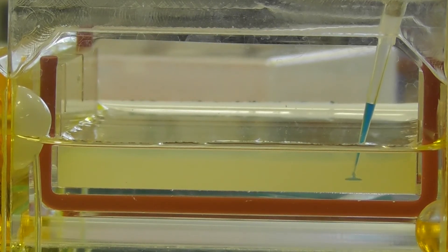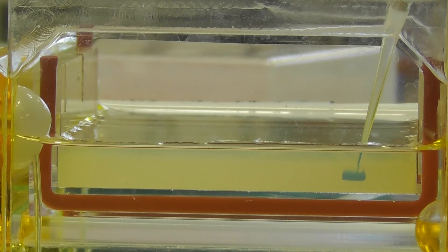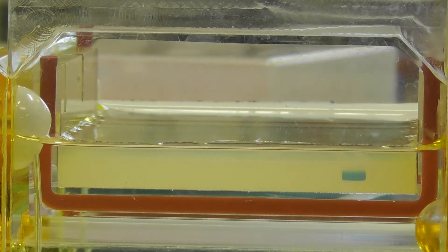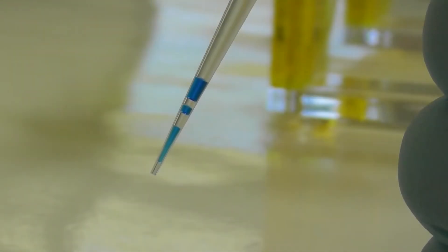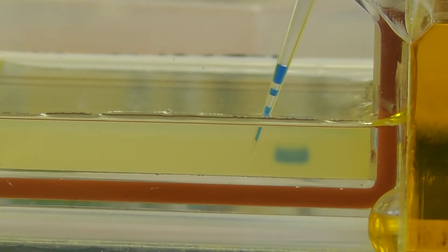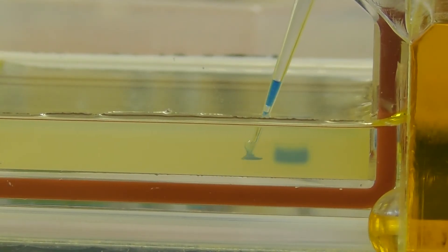Resting your elbow of your pipetting hand on the bench will help keep your hand steady. Avoid sucking up air when you withdraw your sample, as this will result in insufficient sample being loaded, and air bubbles will carry sample out of the well.